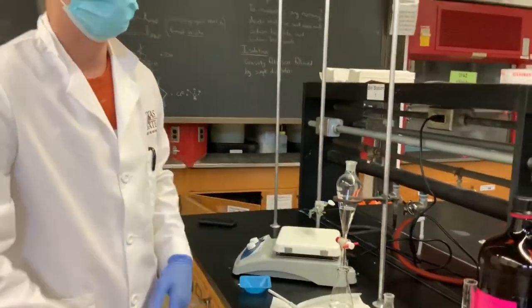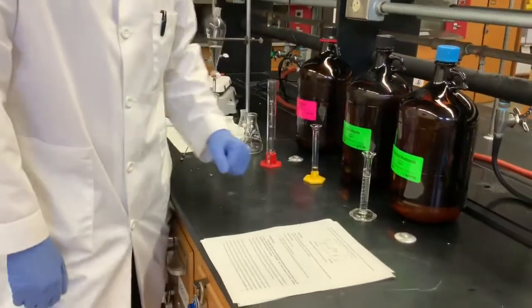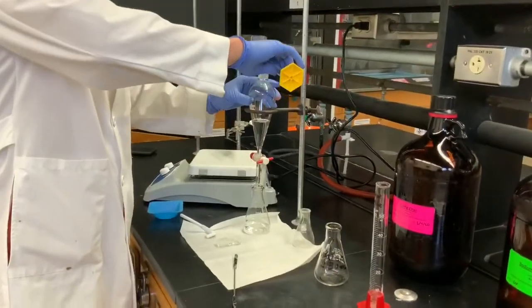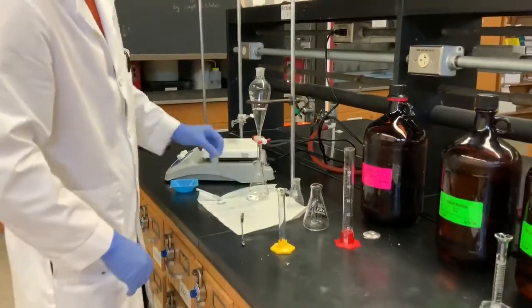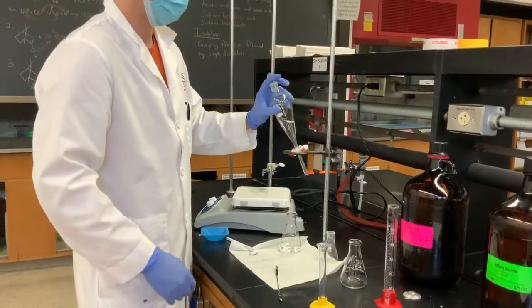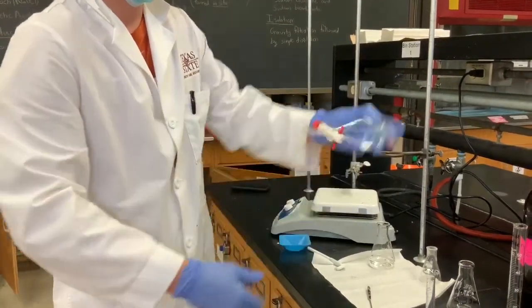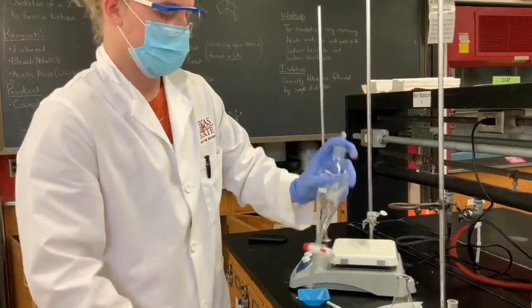In case there are any trace amounts of acetic acid left, we're going to add these neutralizing agents: sodium bisulfite and sodium bicarbonate. First will be two milliliters of sodium bisulfite. It's important to know that if there is remaining acid, this reaction will create a lot of gas, so it's important to vent this regularly. You can turn it upside down, or shake and release from the top. As you heard, there was gas released.